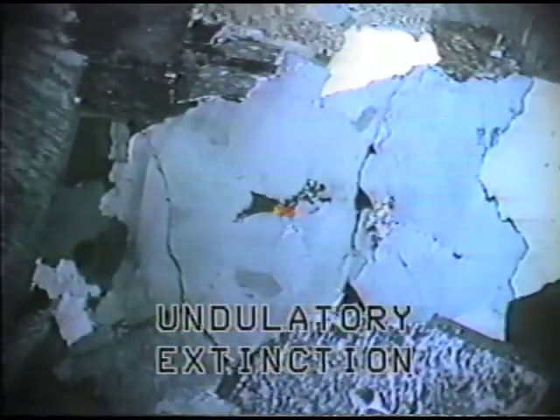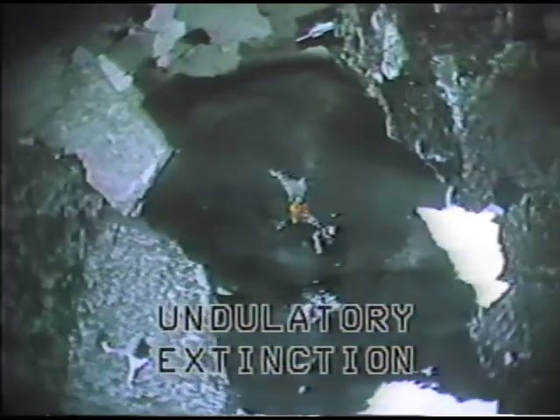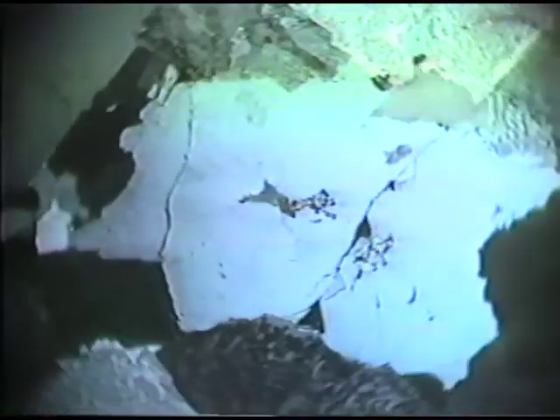These quartz grains do not have a simple coherent extinction. Instead, extinction appears to migrate or undulate across the grain. This style of extinction is called undulatory extinction, and it is characteristic particularly of quartz in rocks that have been metamorphosed or strained to some degree. Quartz is one of the very few minerals that shows it, and so it can be used as an identification criterion for quartz.